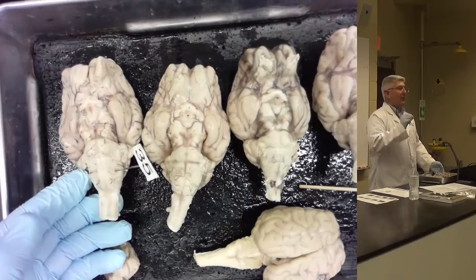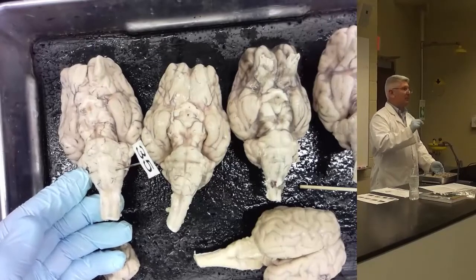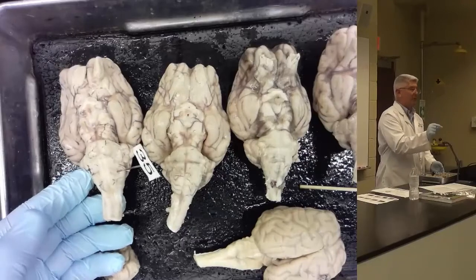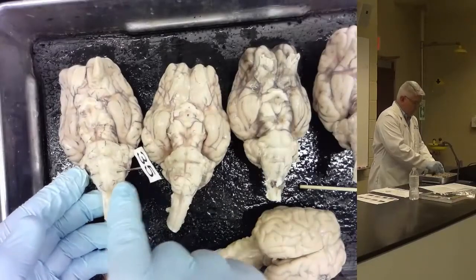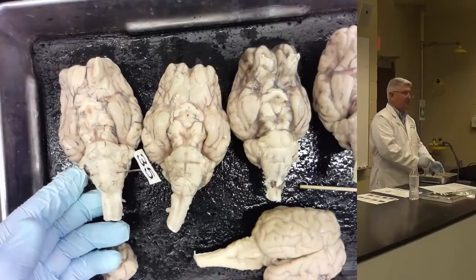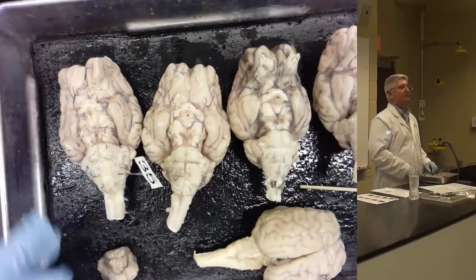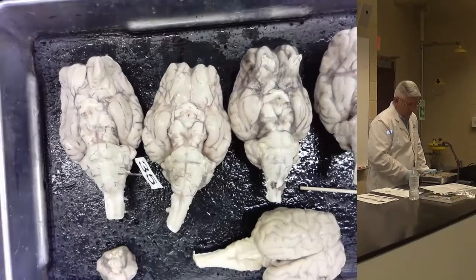The pyramid is part of the medulla, but if I have the pin in the pyramid and you put medulla, it's wrong, because it's a more specific part. It's the pyramid of the medulla. So if I'm marking medulla, it'll always be away from the midline. You'll be able to see the pyramids as your landmark, and it'll be over here, lateral. Do we need to put medulla or the full name? Medulla is fine. All right.